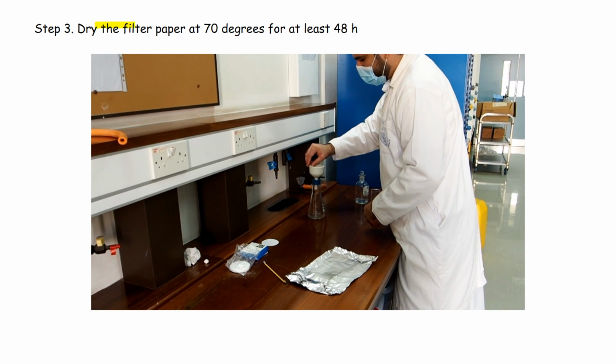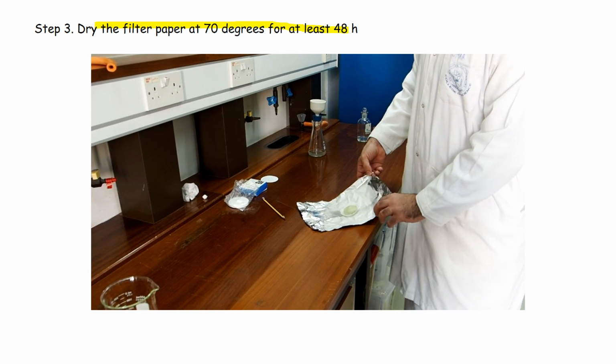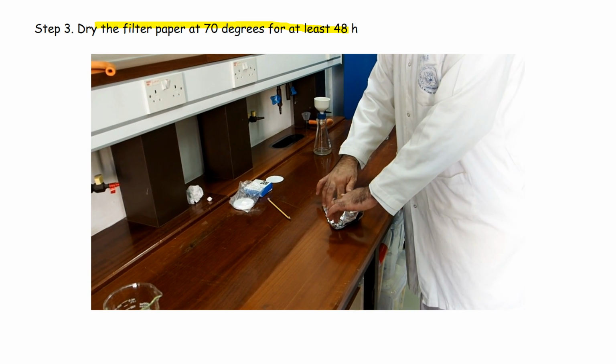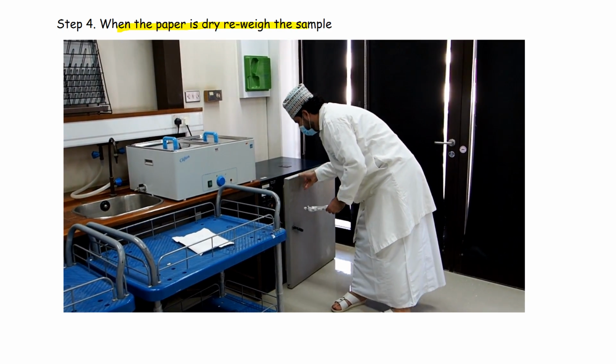We dry the filter paper in an oven at 70 degrees for at least 48 hours. When the paper is dry, it is re-weighed.